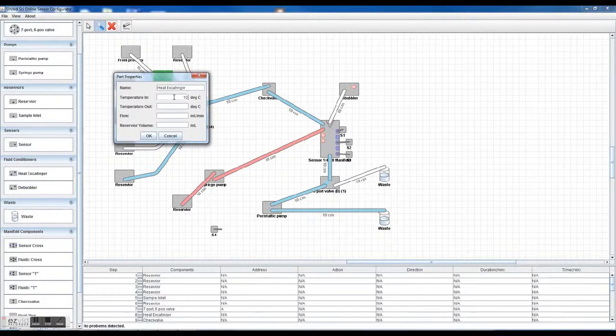And as you populate these things, it allows us to engineer the system so that it will work with the components and they'll all work together. If you have a 200 degree in and you want a 100 degree out, obviously we'd have different connectors, different fluidics, maybe you'd use stainless steel systems instead of plastic systems and stuff like that. So yeah, sometimes the reservoir volume here, say 20 milliliters.